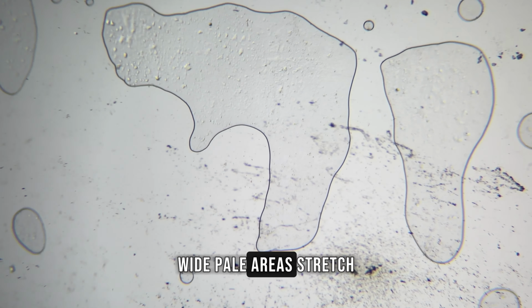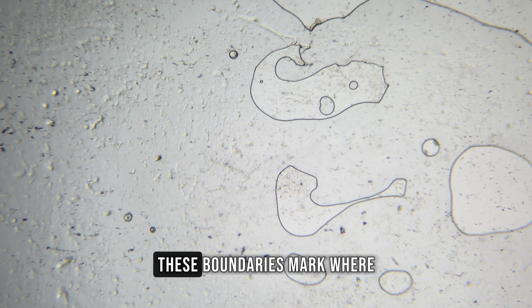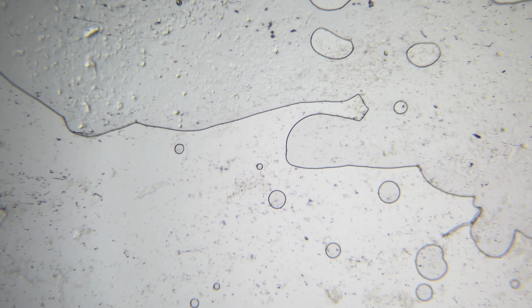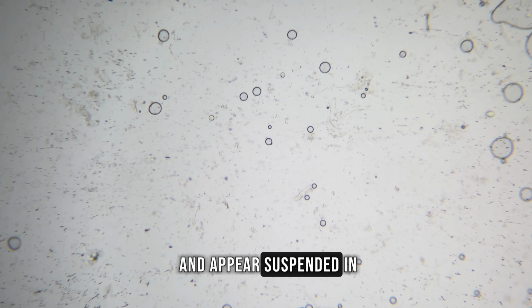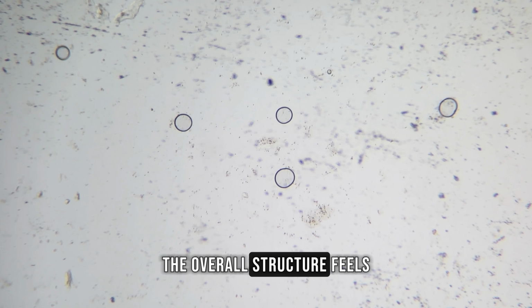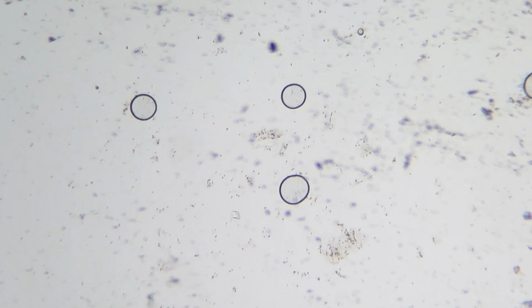Wide, pale areas stretch across the sample, separated by soft, curved boundaries. These boundaries mark where the material gathered during preparation. Small, round shapes are scattered throughout the field of view. They vary in size and appear suspended in a mostly clear background. The overall structure feels fragile and unstable. Nothing looks compact or firmly connected.